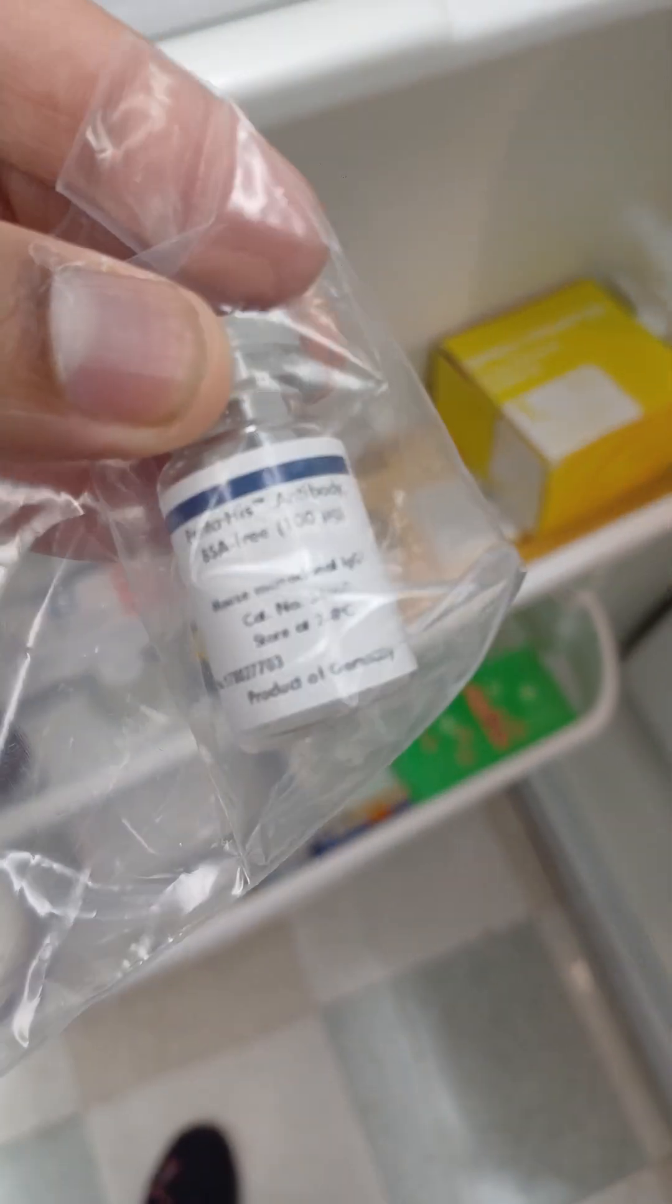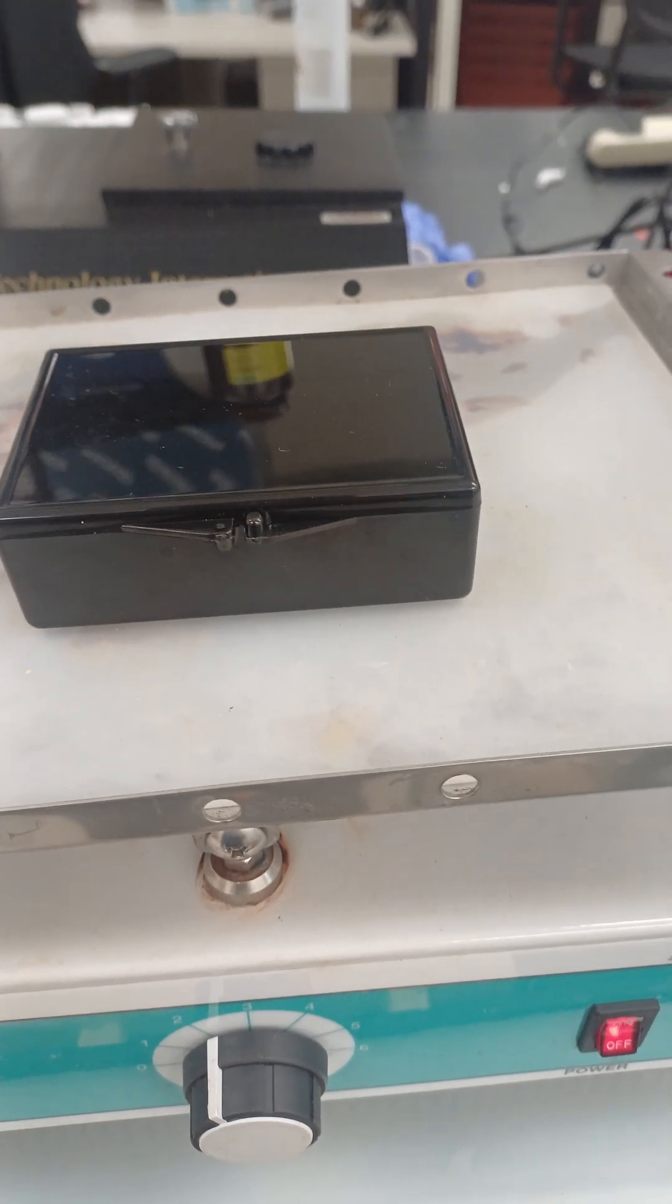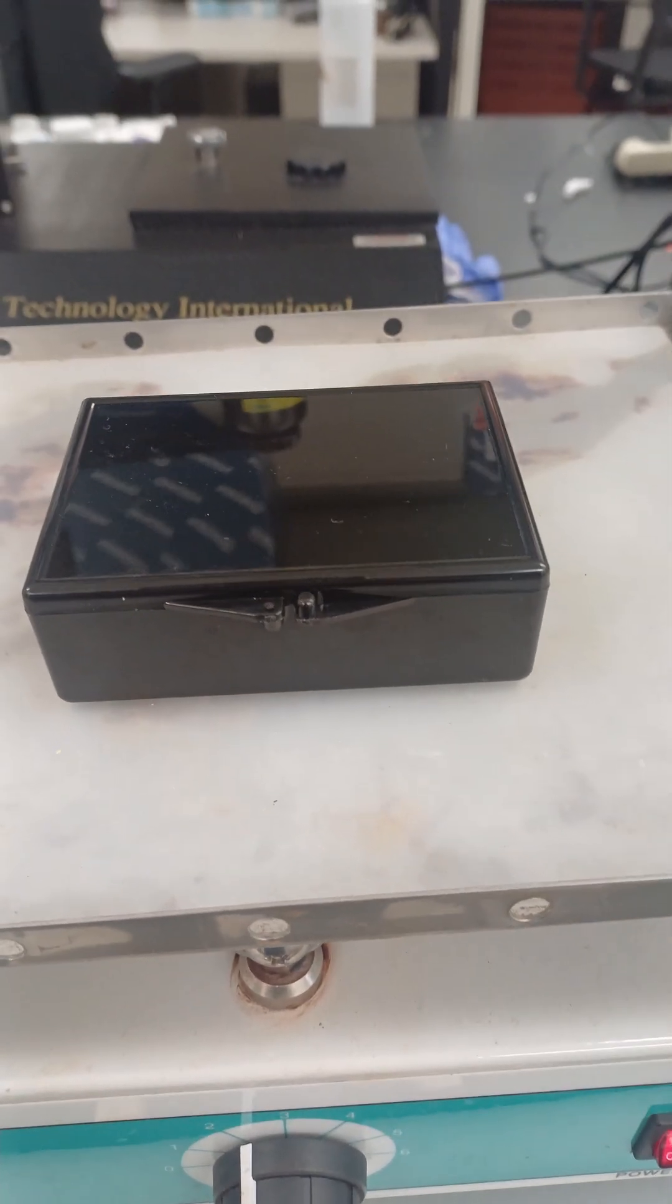Time for the primary antibody. I am using a penta-his antibody that binds specifically to my his-tag protein. Incubate for an hour at room temperature or overnight depending on the antibody.